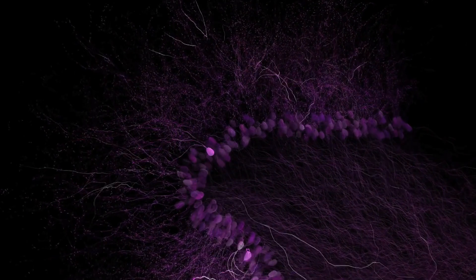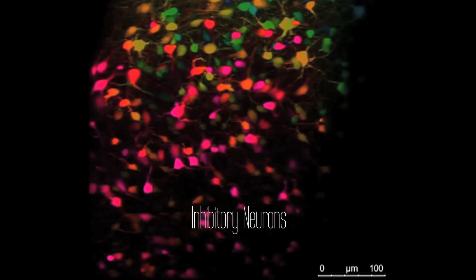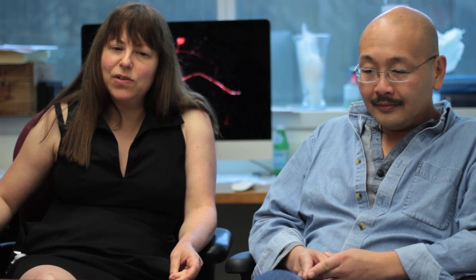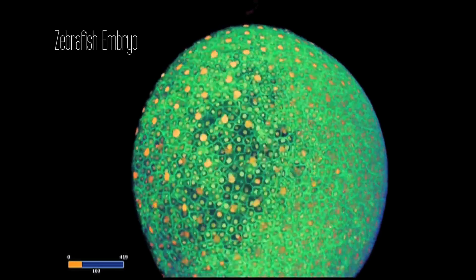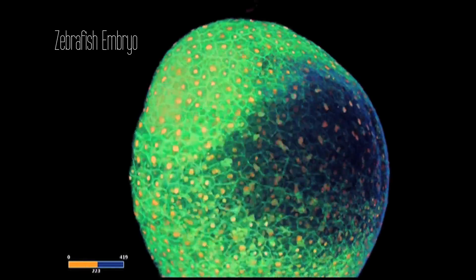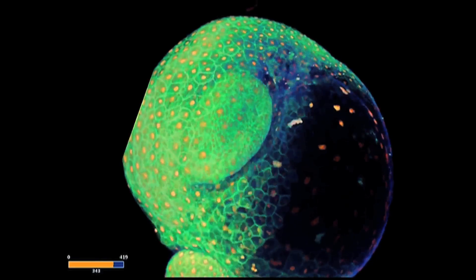What we do is we pick one of them and we color it with the fluorescent protein, and that way we can see it isolated. Before the introduction of multiphoton microscopy to biological imaging, our ability to actually monitor structural changes in individual cells in our brain was basically nonexistent.